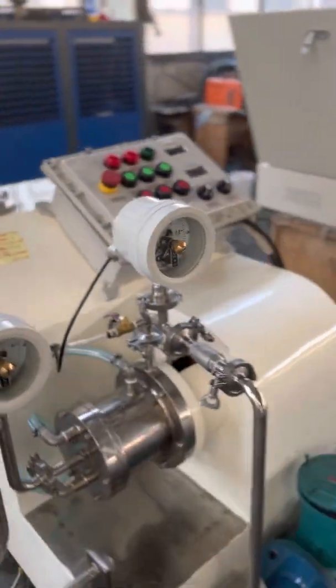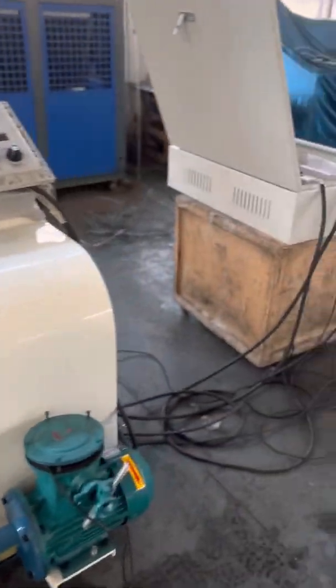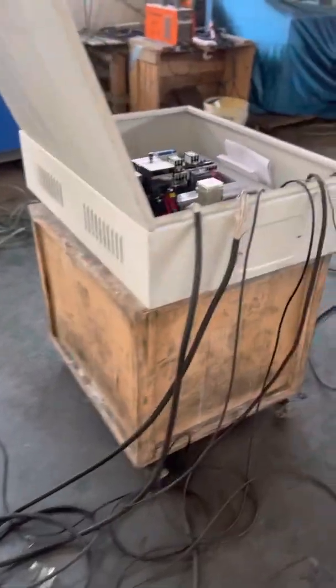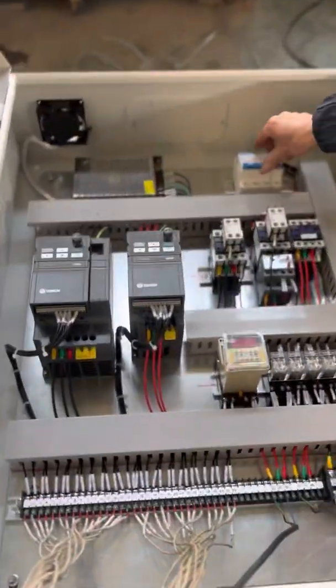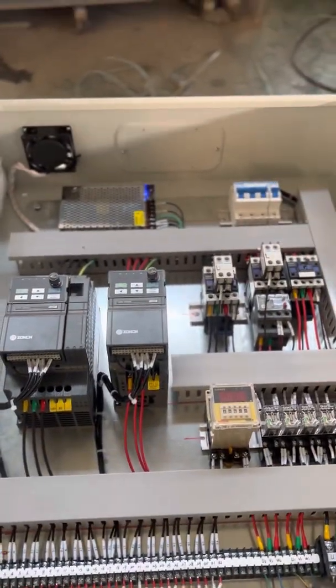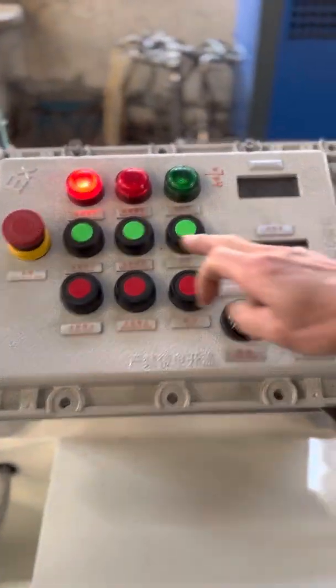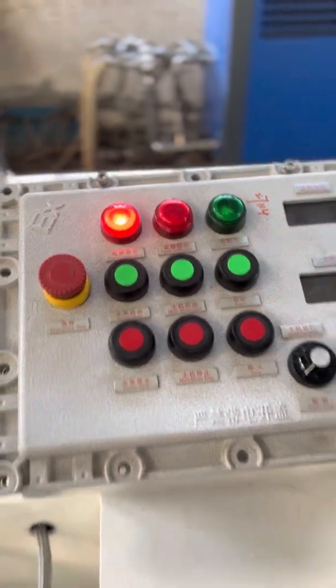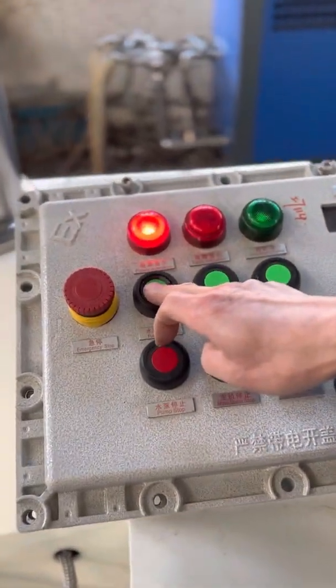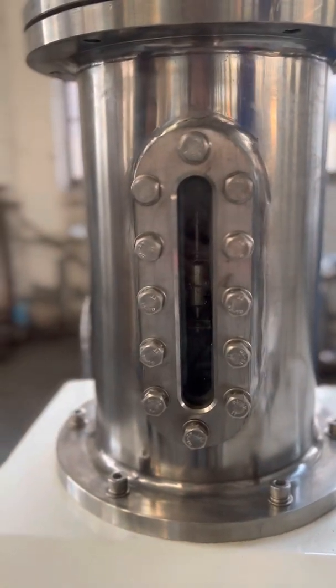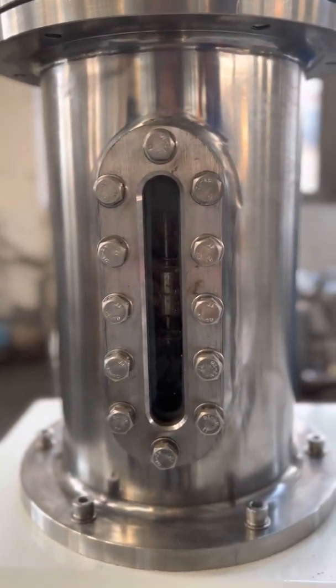Okay, let's start the machine. Firstly, turn on the power and you can see the light is on. Pump start. Checking the flow-in of the liquid. You can see the flow-in.